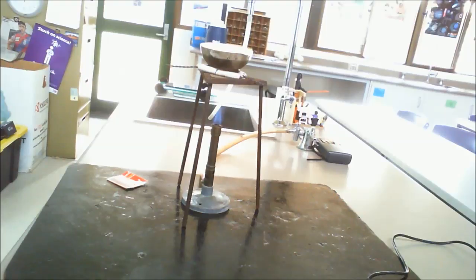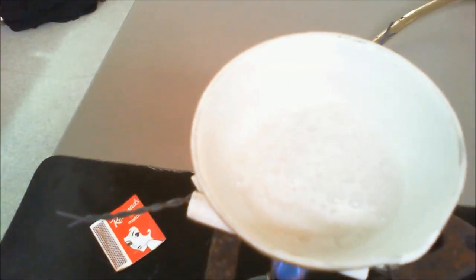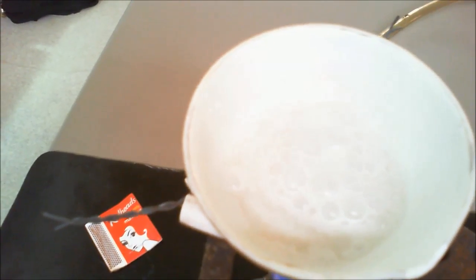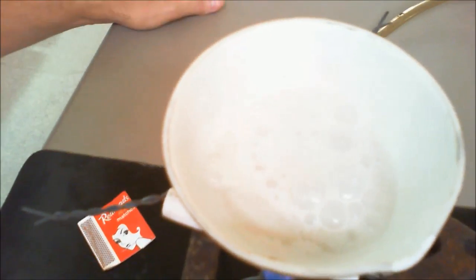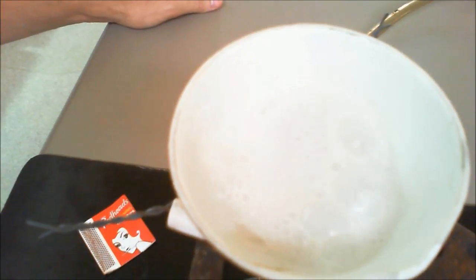Always nice to see what is happening with this. So what I'll do is I'll just take the video out, and hopefully we can have a little bit of a look at what's going in there. You can see that is starting to bubble, so it's starting to evaporate out. You can start to see that there's white powder being formed on the outside. Okay, so you can see lots of bubbling there.